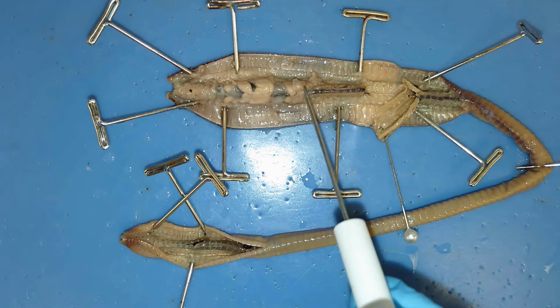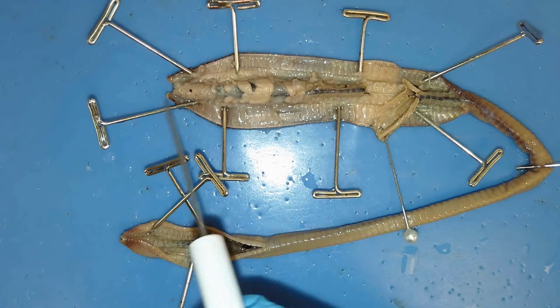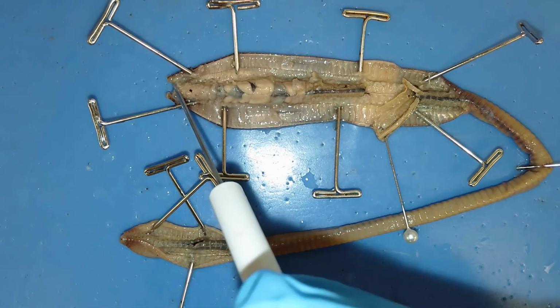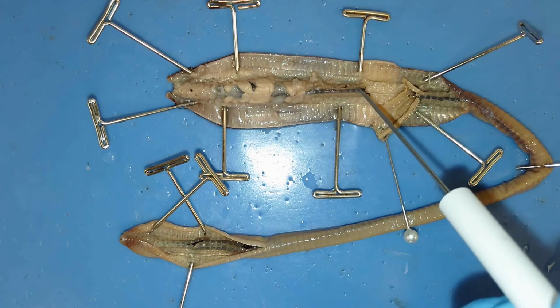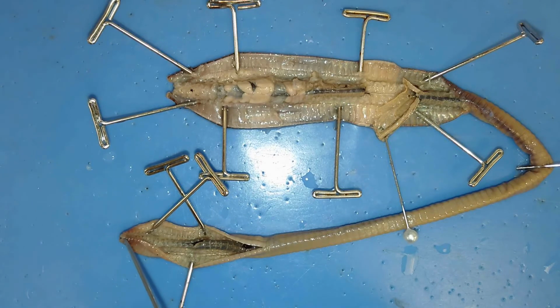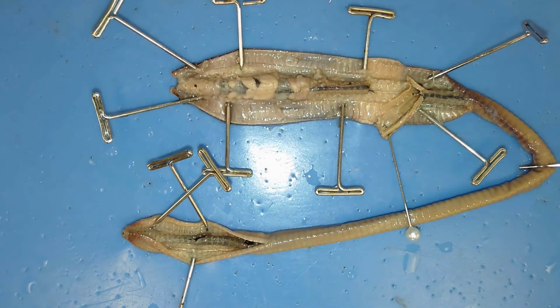And so this next structure is the intestinal tract, which I just tore open a little bit. In simplest terms, food's traveling from the mouth right here to the pharynx, through the esophagus to the crop, gizzard, and then through the intestine, where it travels the length of the body to the anus here. That intestine is super long because it has to glean as much nutrients from a fairly nutrient-poor food source.